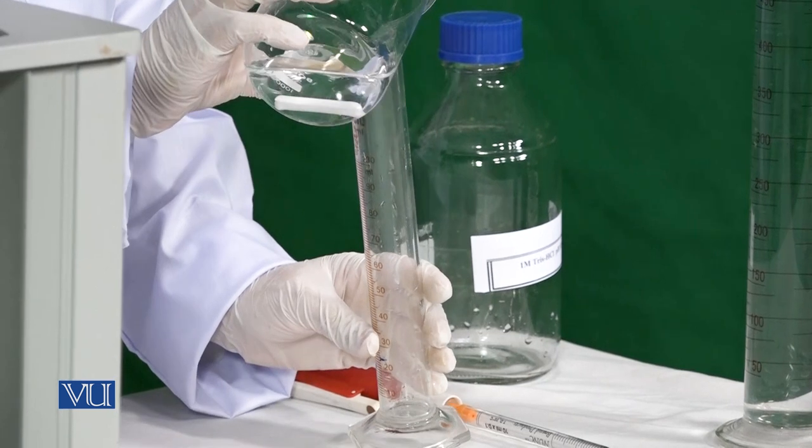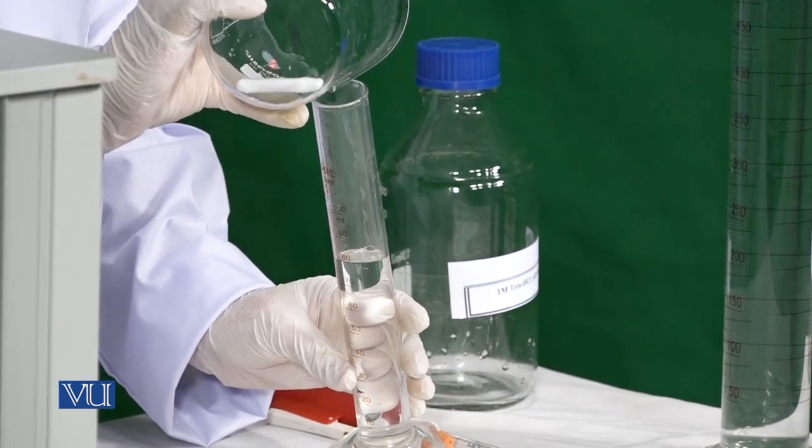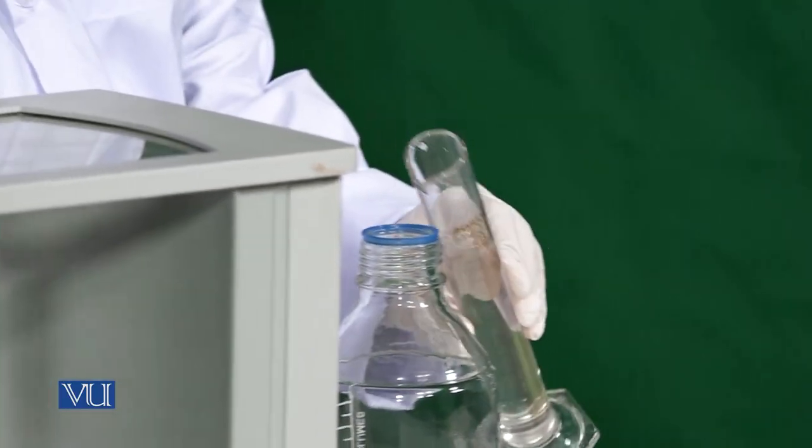After complete dissolution of the powder and setting of pH, we will now make the final volume. As we are preparing 1 molar Tris solution of 100 ml, we will transfer all the volume into a measuring cylinder, then add water to make it 100 ml. Now we need to store the prepared solution in a clean reagent bottle at its appropriate storage conditions. This is 1 molar Tris solution pH 8.